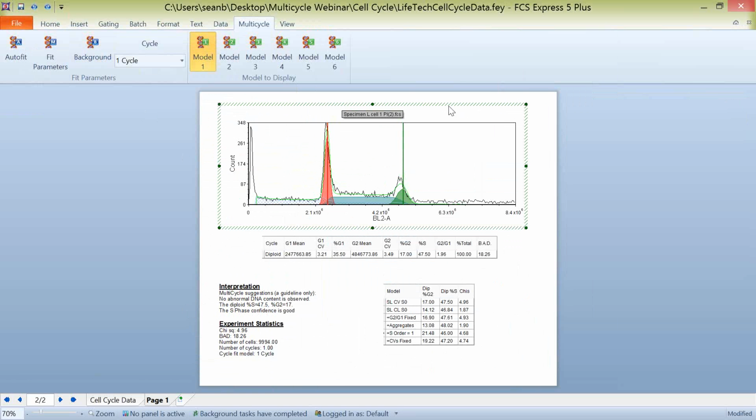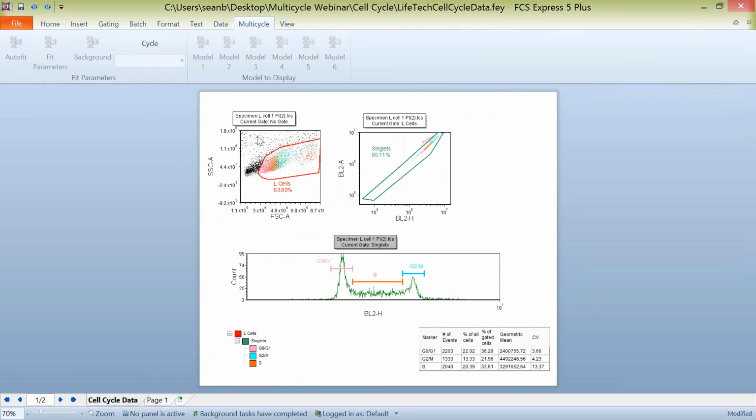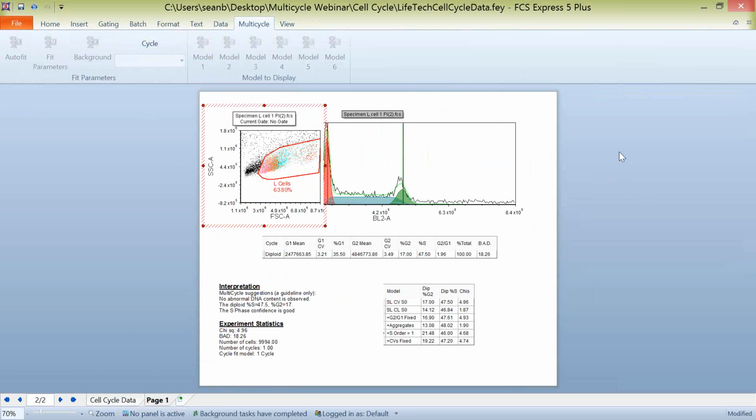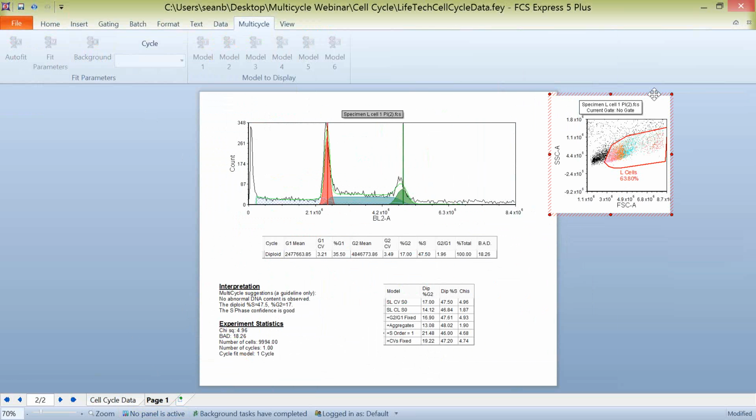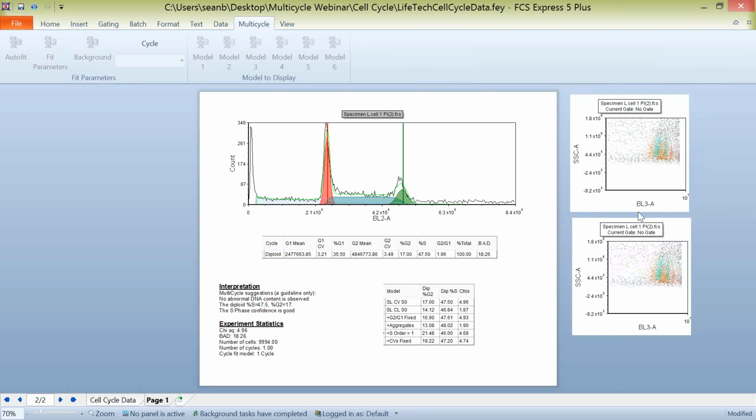Now, one of the final things I wanted to discuss about working with multi-cycle plots is the ability to create a gate directly on a multi-cycle plot itself. And the reason you might want to do that, I will just actually grab our scatter plot from the first page, is if you wanted to compare, say, your G2 to G1 on a different parameter. So we've defined our DNA analysis and our mathematical modeling based on our BL2A parameter, but we also have a BL3A parameter. And we want to look at how G1 and G2 compare with this parameter for these different populations.